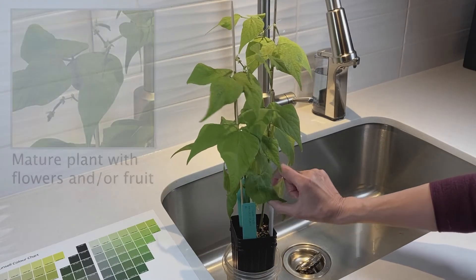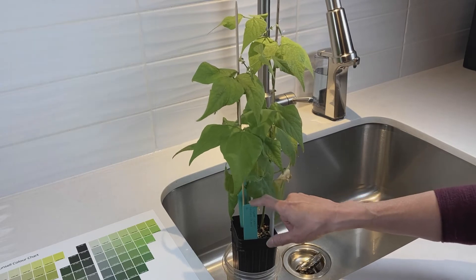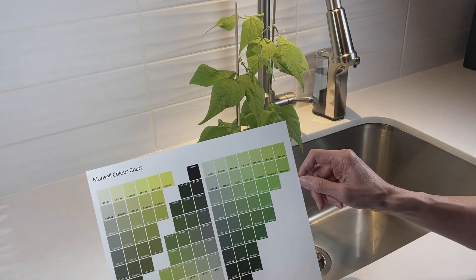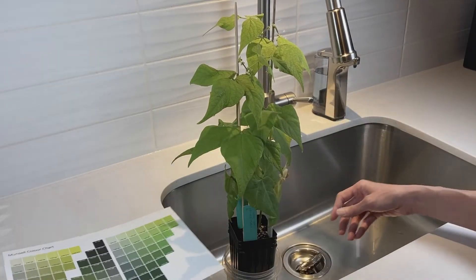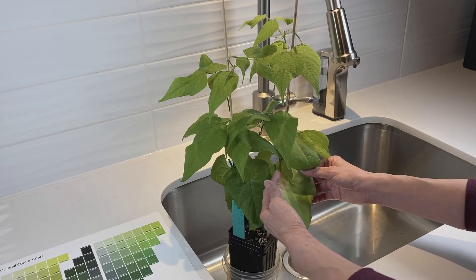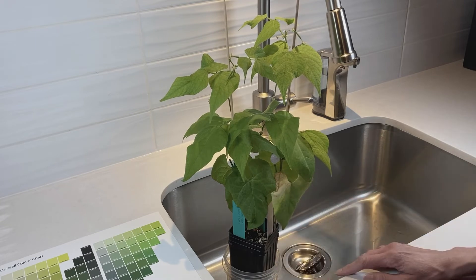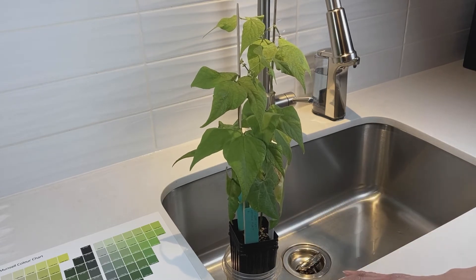Here we have treatment D. Treatment D is the mature plant that you planted back in January. I've got my pot labels — plant number one and plant number two. For treatment D, it's the mature plant — you're just going to observe it, you're not going to do anything to it, except like the others, you're going to use your Munsell color chart and match it up to the colors of your primary leaves and pick the color chip that closest matches it. It's okay if one leaf has gone a little yellow or dried up — you can still use it, just record the colors and take pictures. Do your recordings every other day or three times a week for a period of two weeks.